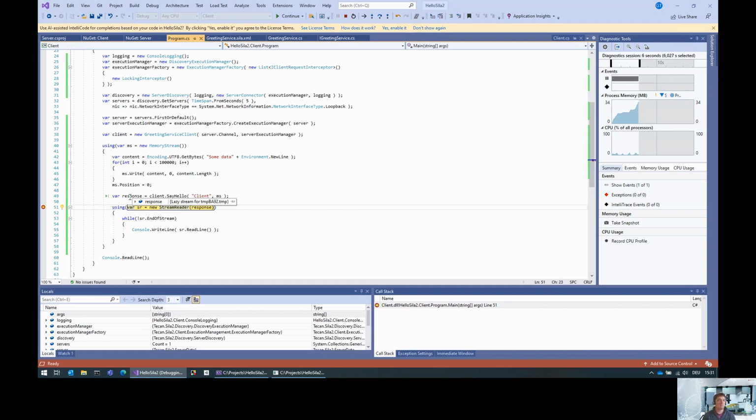And that actually means that the contents of this response are too large to put into the request object or into the response object. So what is happening is that the SDK creates a storage identifier for the request object, then uploads the contents that we passed into this memory stream, and afterwards creates a binary storage identifier and uploads all the chunks. Then the actual command is happening.